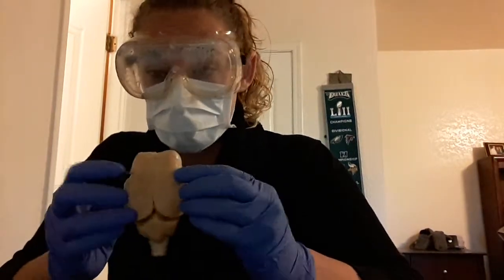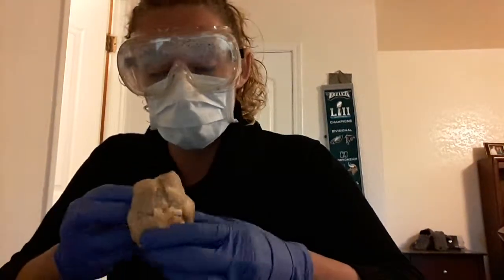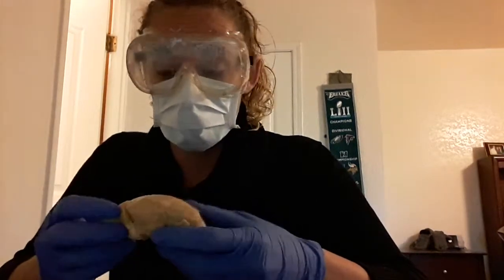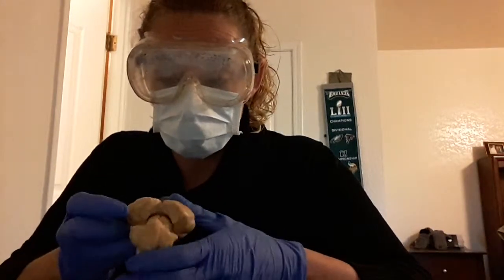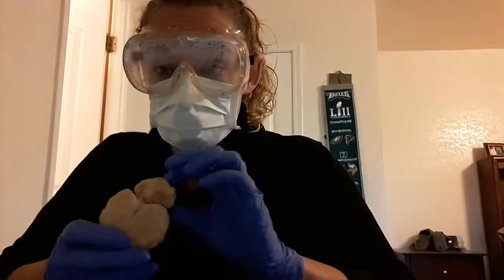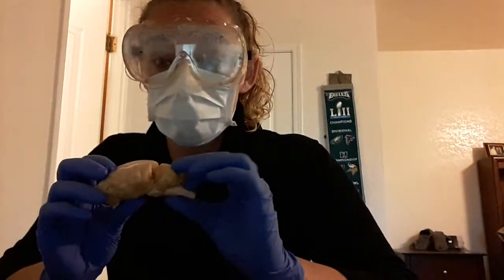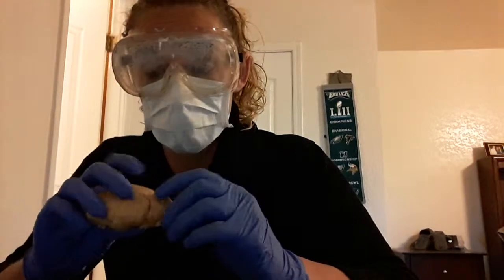Your parietal lobe is a little bit further on the side here. It kind of comes down a little bit. Then you got your temporal lobes. Your occipital lobes are back here. Let me move this out of the way real quick. So your occipital lobes are back here. This part is the cerebellum, also known as the small brain. A lot of stuff goes on back here. The sheep's spinal cord, I pointed out earlier, is here.